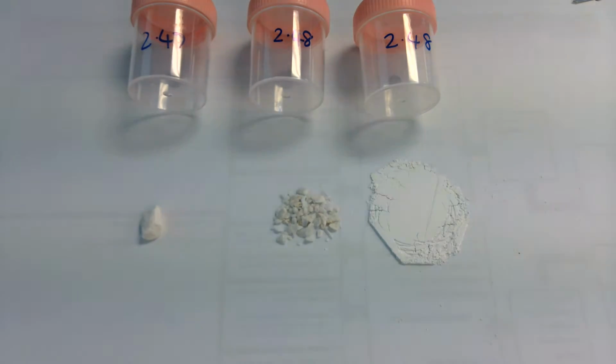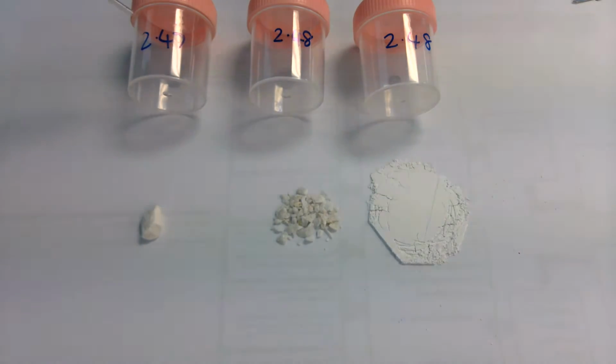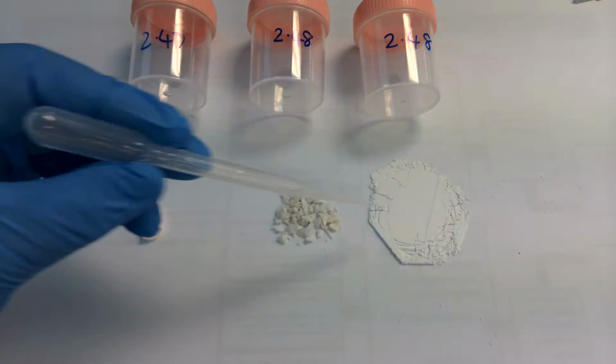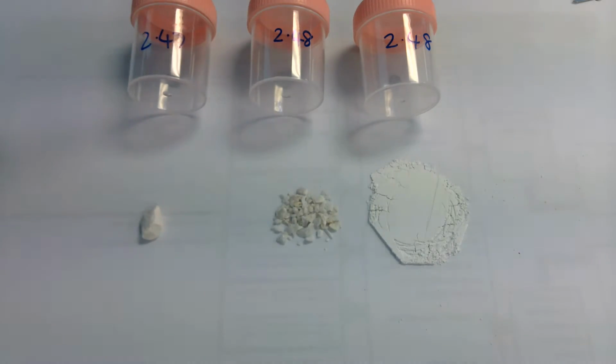So our next setup is to change the factor surface area. What we see here is 3 different sets of surface area with the same or similar mass. In this case the reactant is calcium carbonate, and we can see that the mass of this chunk of calcium carbonate is 2.47 grams. The mass of these pieces of calcium carbonate is 2.48 grams, and the mass of this powder of calcium carbonate is also 2.48 grams, and the difference between the first, the second and the third is 0.01 grams, which we can explain in the evaluation.